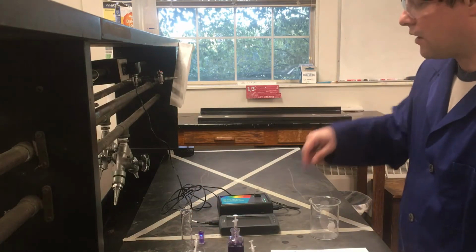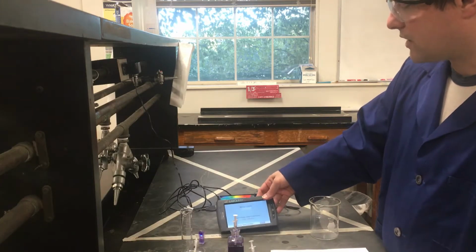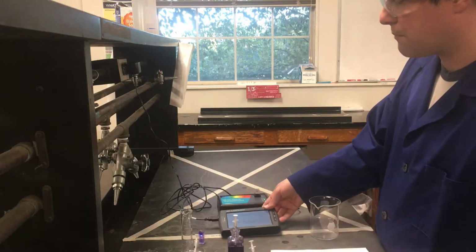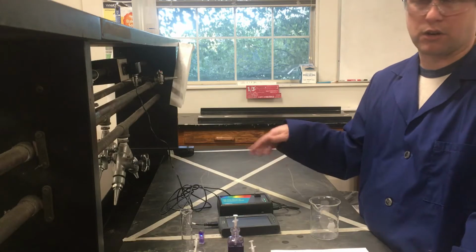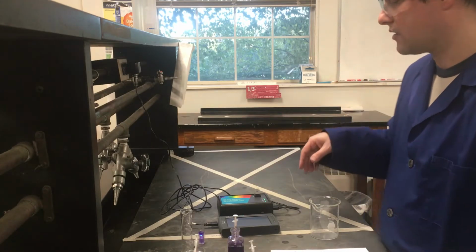we're going to be making our measurements. All right, at this point, my 90 seconds should have passed. And so my LabQuest is now telling me the warm-up's complete, so I can now tell it to finish the calibration with my blank sample, which is just the water. If you're using a different solvent than water, you would want a blank cuvette filled with whatever your solvent is for your solution.